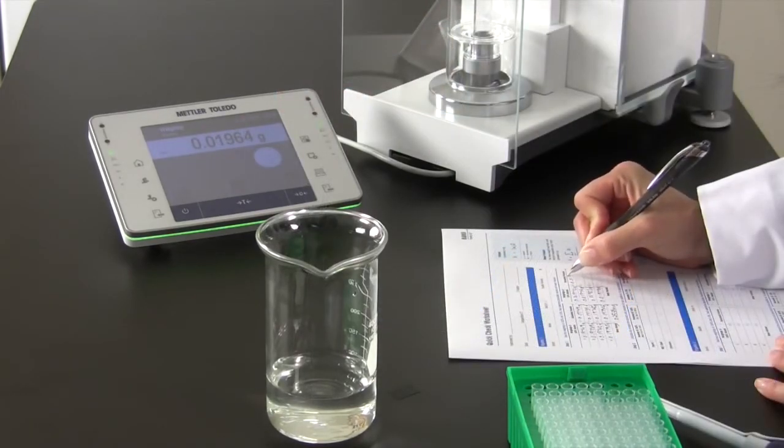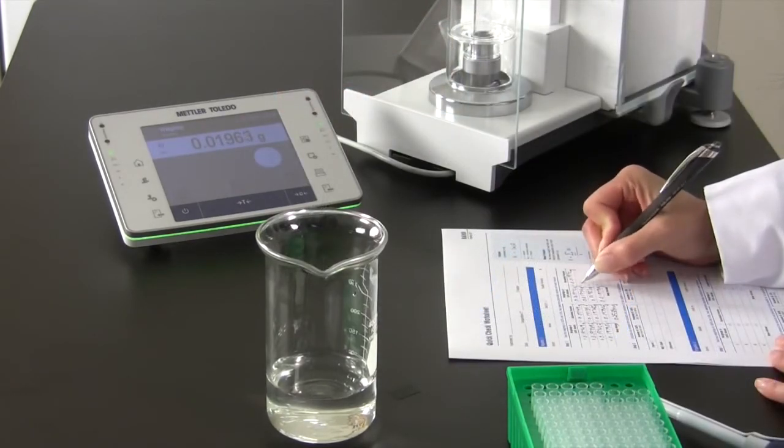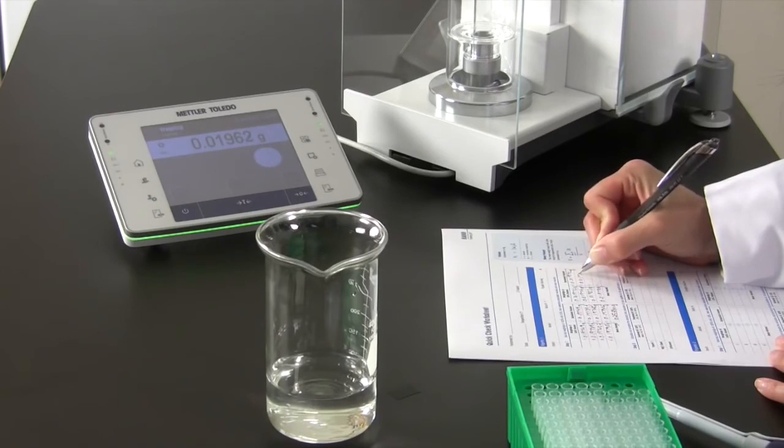With the data you have collected, you can now calculate the pipette's mean volume, accuracy, and precision.